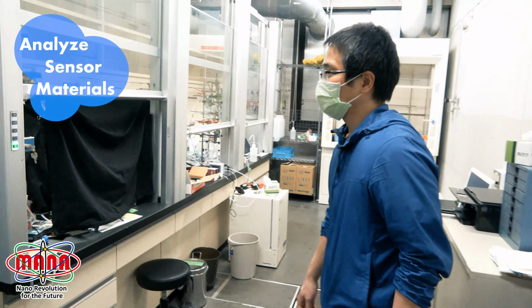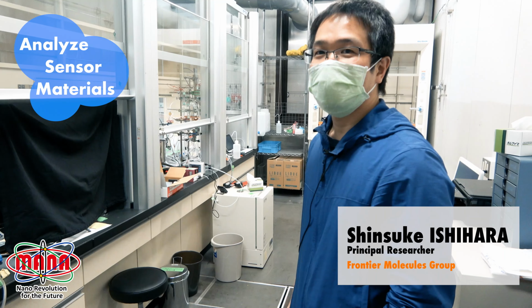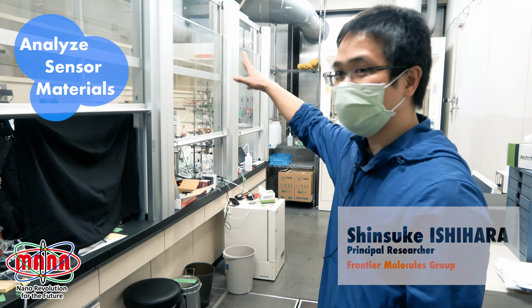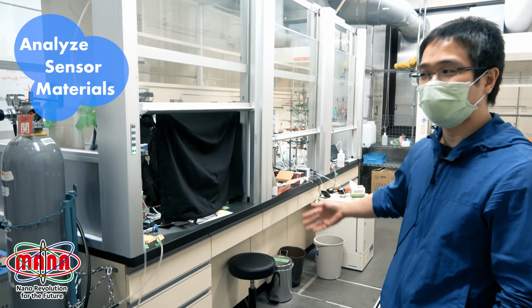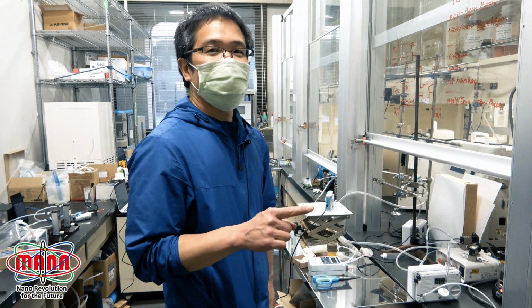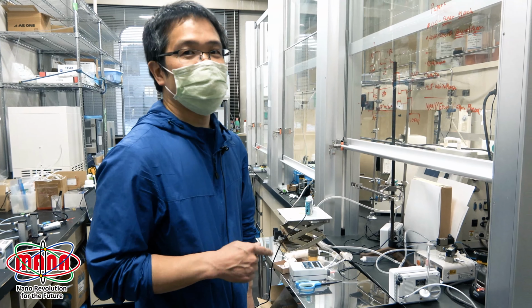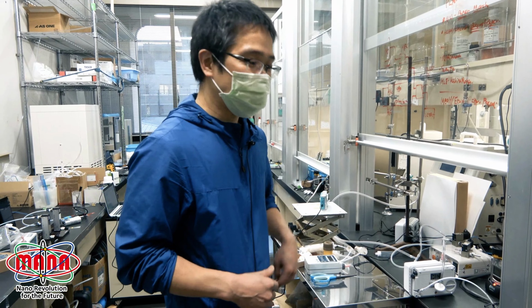Okay, so in this laboratory, we are studying sensing materials, and there are many setups to evaluate chemical sensors, especially for gas molecules. Nitric oxide, NO, is a selective pulmonary vasodilator that is medically used in practical application.